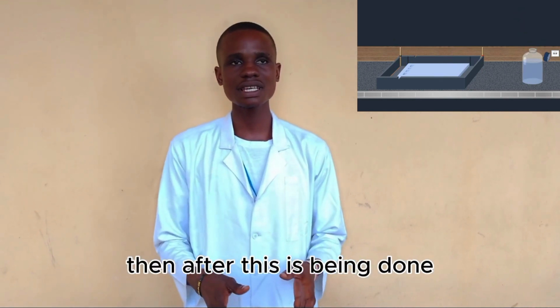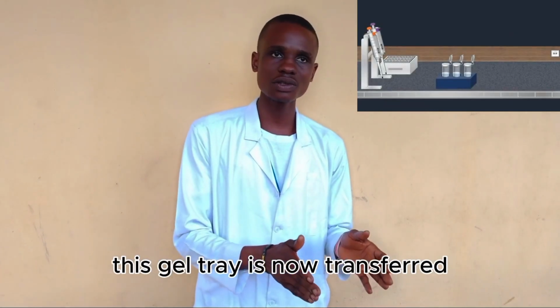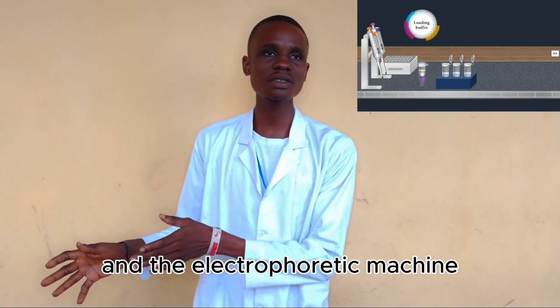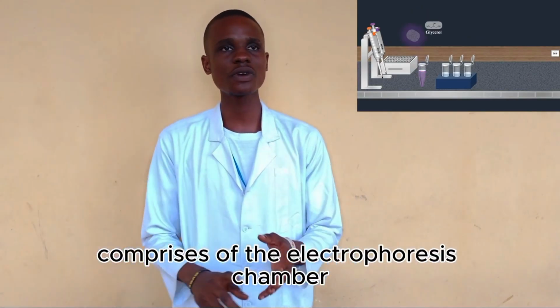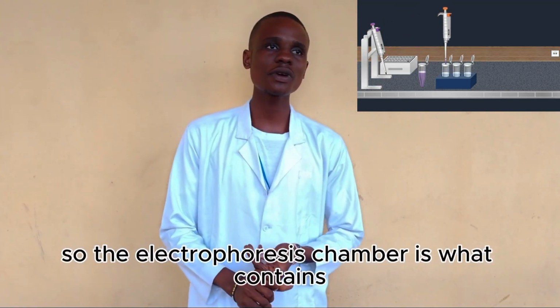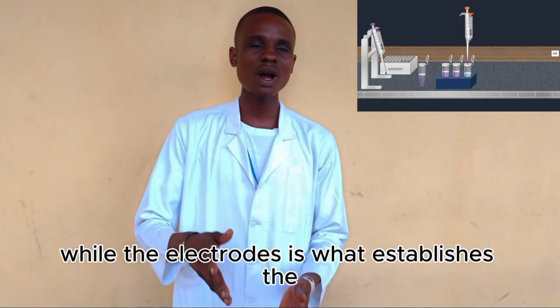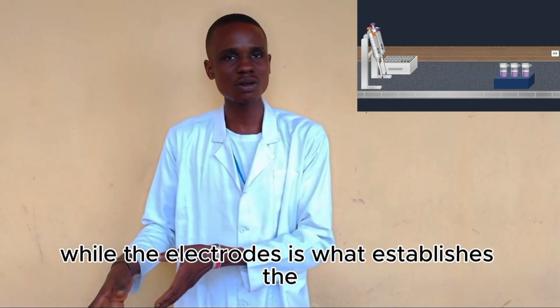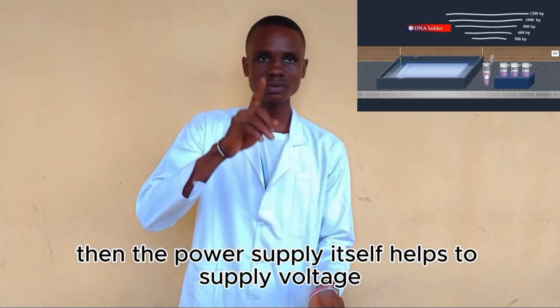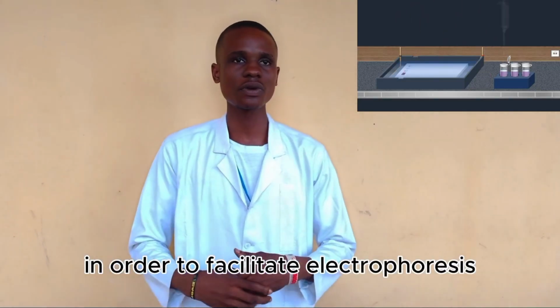Then, after solidification takes place, this gel tray is transferred to the electrophoretic machine, and the electrophoretic machine comprises the electrophoresis chamber, the power supply, and the electrodes. So the electrophoresis chamber is what contains the gel tray, the electrodes, and the buffer itself, while the electrodes establish the current between the gel and the buffer. Then the power supply itself helps to supply voltage in order to facilitate electrophoresis.